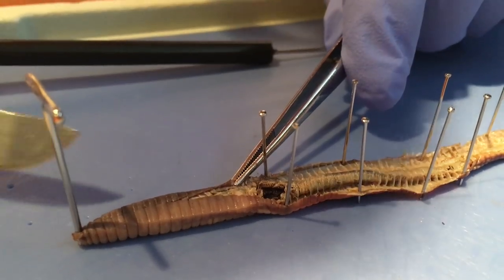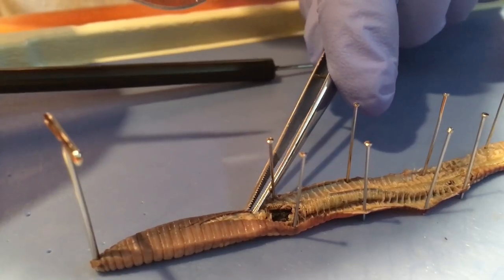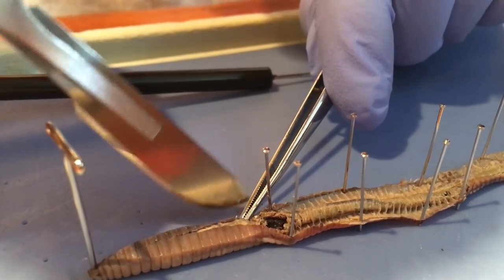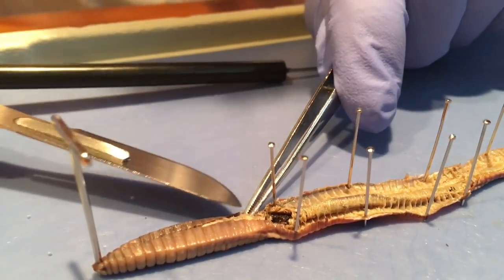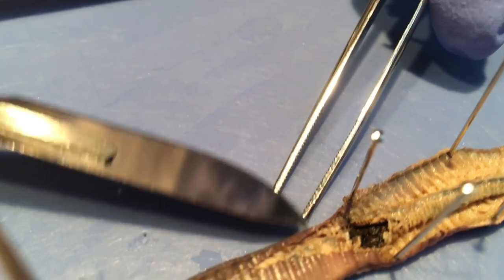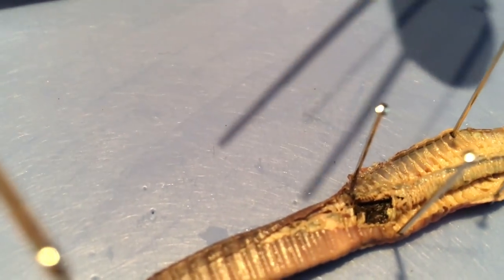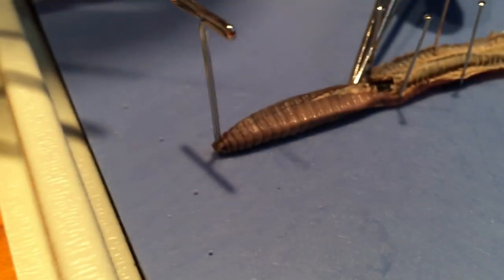It is very sad, but now he called a new girl, so it's cool and he got another heart. There's a big heart right there — let me see, point to it, right there. Isn't that the gizzard? Oh wait, you may be right. I think that's a gizzard. Yeah, you're right.